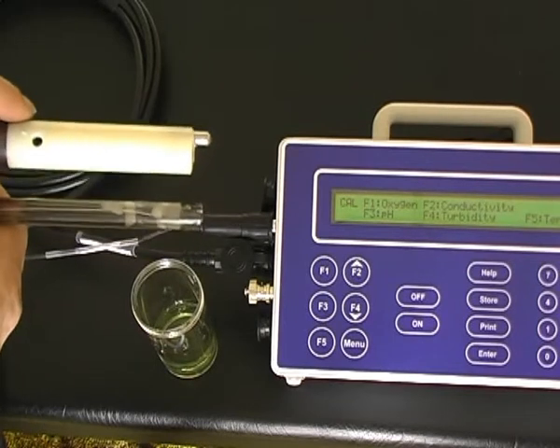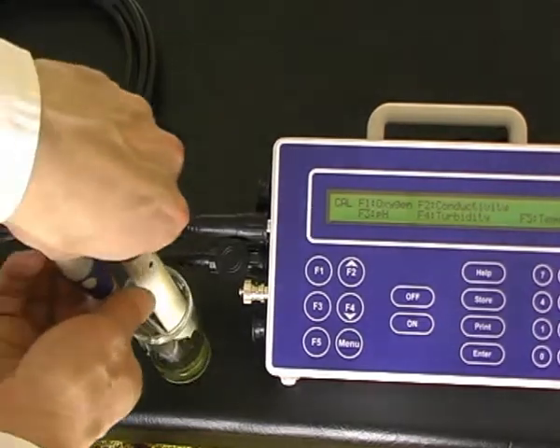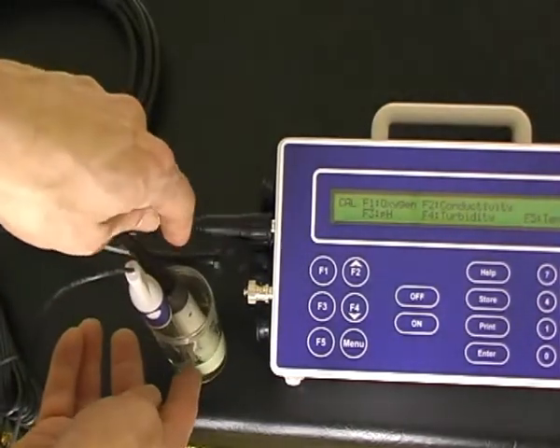Here, we're about to calibrate pH 4, the first point pH calibration. Place the sensors in the solution.